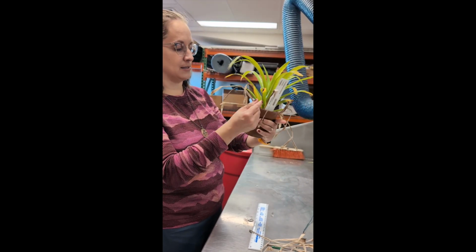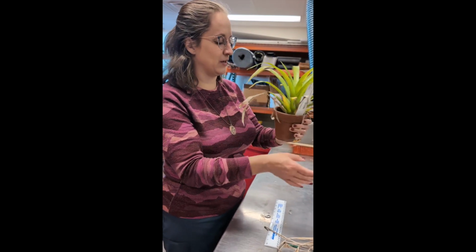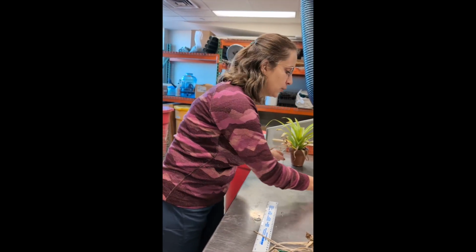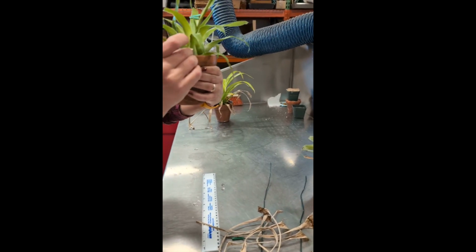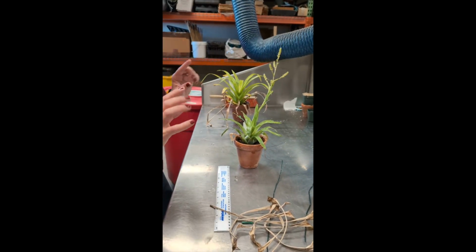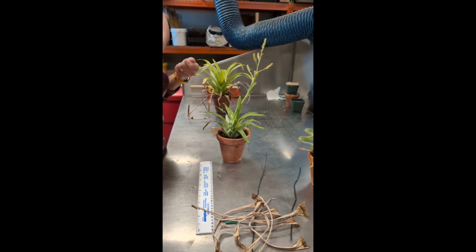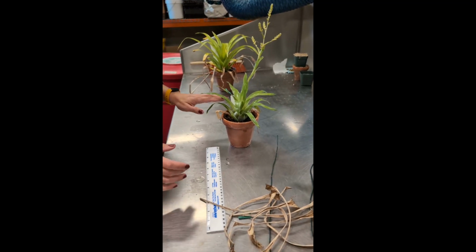So sometimes it's nice to do like a little prune on your friends as you're doing this. Starting at the bottom, I'll go back to the one I was doing here. So I have some dying leaves, but they still have some green and they are attached. So this is a way to do this and keep track of the leaves as you go without hurting them, writing on them with a Sharpie, anything like that. I kind of gently fold them down.